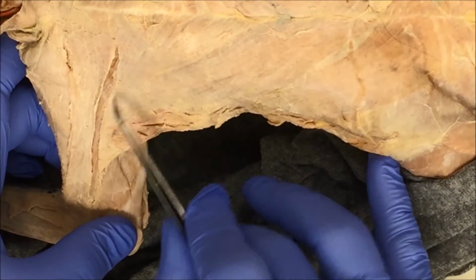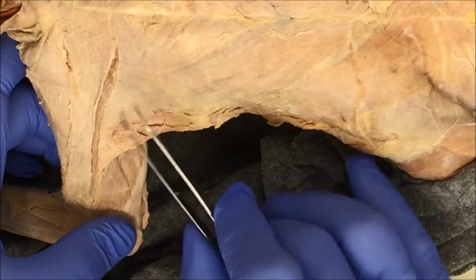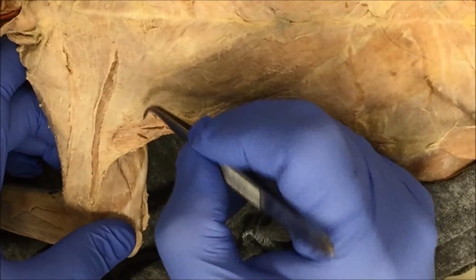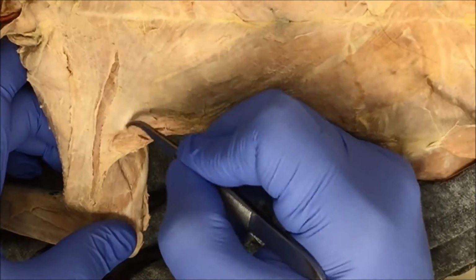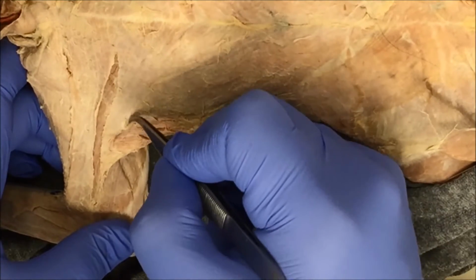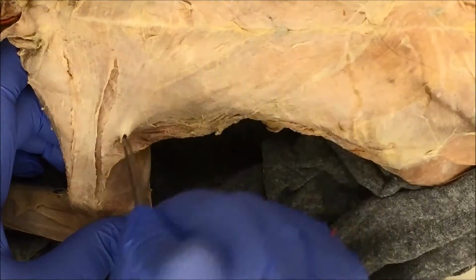The striation goes this way on the pectoralis major, and this muscle underneath it goes this way. So I'm going to simply start working on the connective tissue. I'm not picking down at it. I'm actually just lifting and seeing if I can get my forceps underneath, and then see if I can cut it with scissors so I can clearly see the line. See what happens from there.